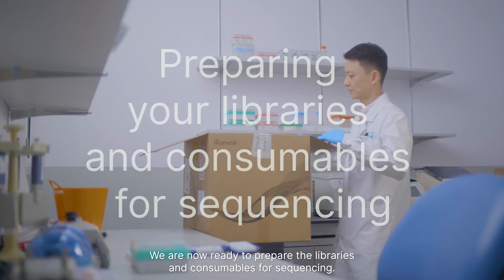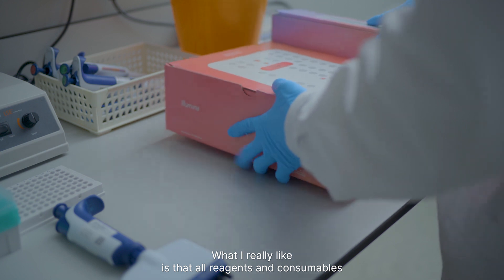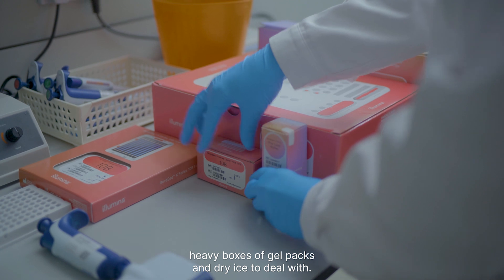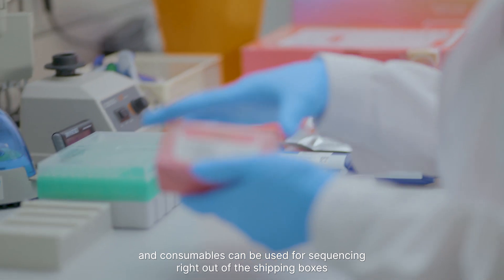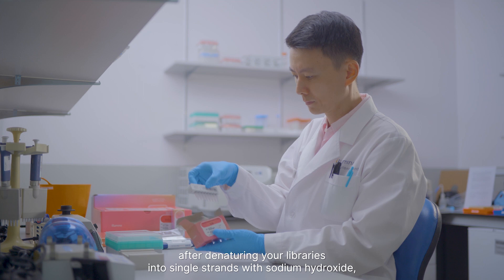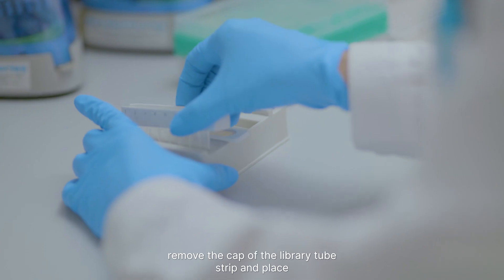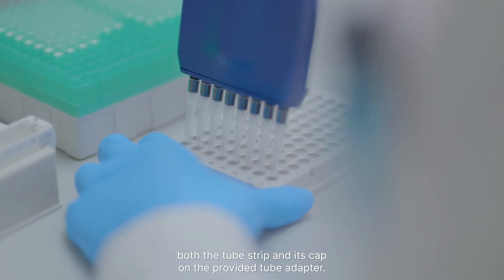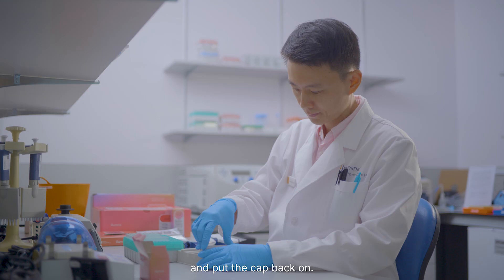We are now ready to prepare the libraries and consumables for sequencing. What I really like is that all reagents and consumables are shipped at ambient temperature, which means no more heavy boxes of gel packs and dry ice to deal with. All reagents and consumables can be used right out of the shipping boxes. After denaturing your libraries into single strands with sodium hydroxide, dilute the denatured library pool with the provided preload buffer. Remove the cap of the library tube strip, place both the tube strip and its cap on the provided tube adapter, then load the denatured and diluted library pools into the library tube strip and put the cap back on.